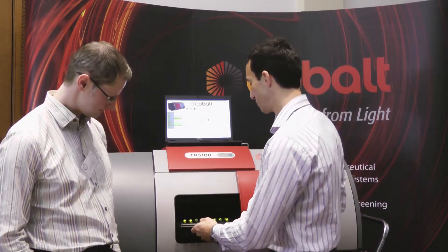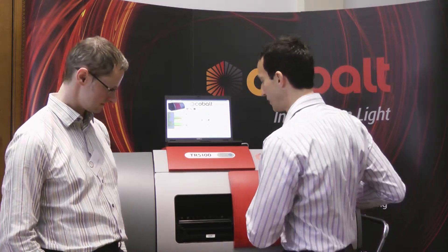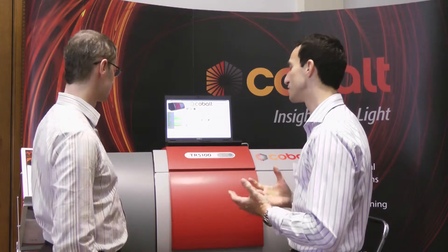So we load the trays into the instrument like this — there's a very positive feel to the sample loading tray — and we close the door. Then we start the software. This is going to measure each of those capsules; each one is just 400 milliseconds per capsule and we get a spectrum from each one. Crucially, it represents the whole volume of that sample — unlike other Raman techniques that just look at the surface. With conventional Raman we just see the gel capsule.